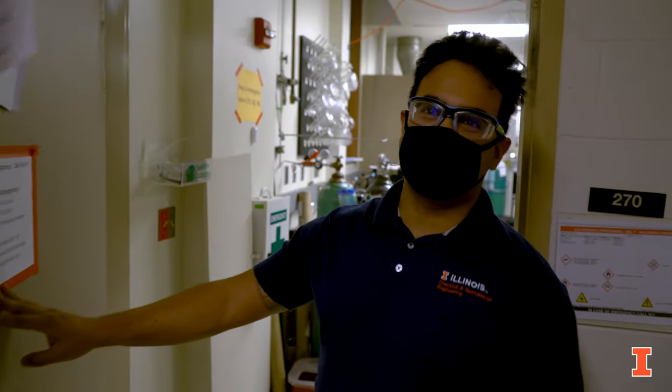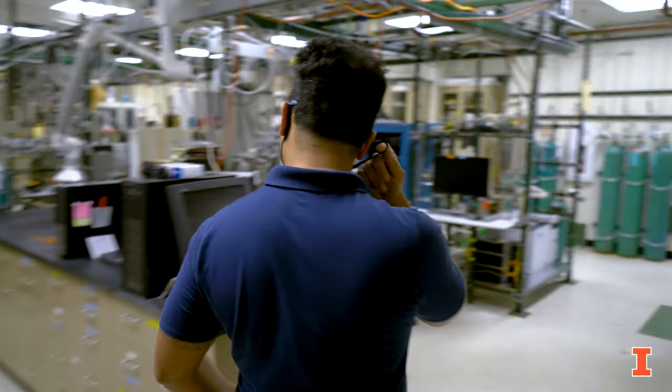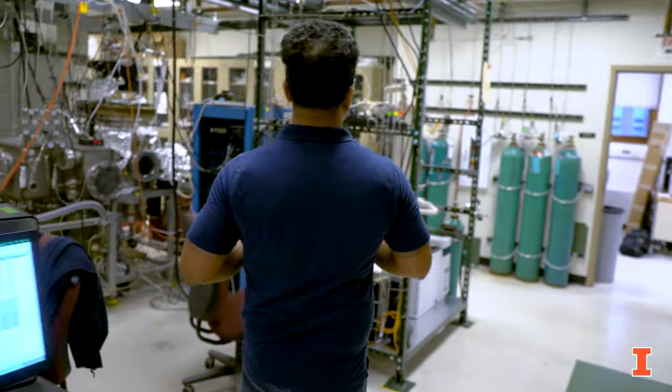Hi, my name is Chris and this is the Flaherty Lab. Come on in. Here in the Flaherty Lab, we combine classical chemical engineering techniques together with modern spectroscopic techniques and other state-of-the-art engineering methods to counter the sustainability and energy demands of a growing population. A day in the Flaherty Lab involves lots of experiments and lots of lab analysis.